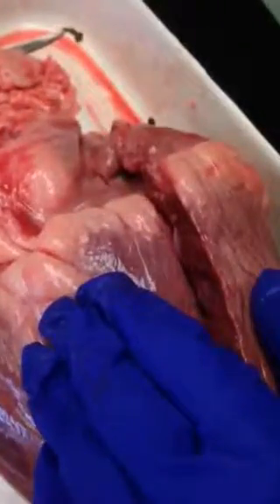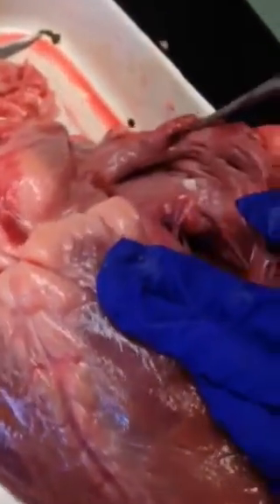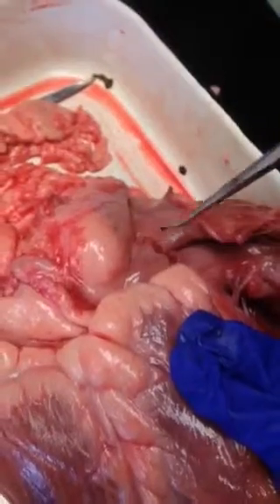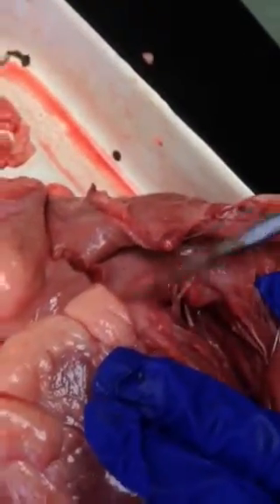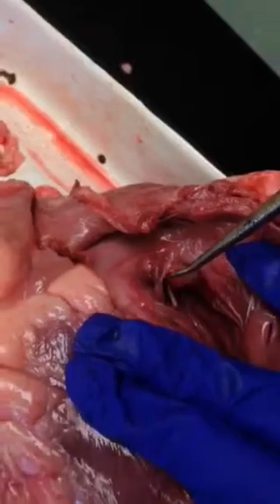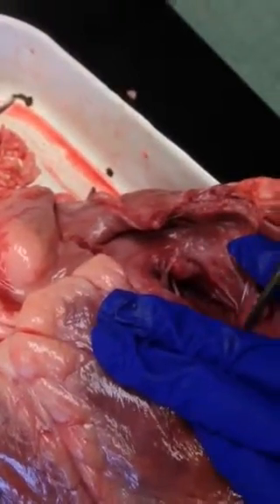Our explanation of the flow of blood through the heart, we're going to open it up right here and start with the vena cava. So deoxygenated blood will flow into the heart from the superior and inferior vena cava and enter into the right atrium. So this structure is the right atrium, and the function of the right atrium is to collect and hold the deoxygenated blood returning to the heart and then deliver that blood to the right ventricle.